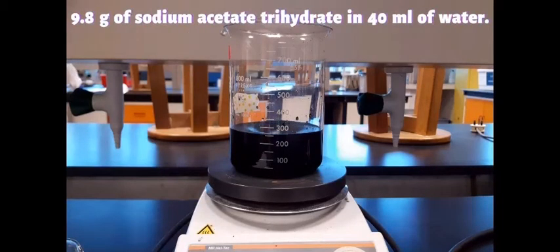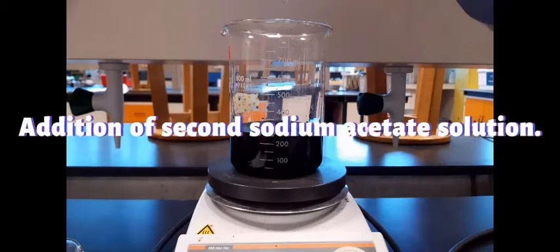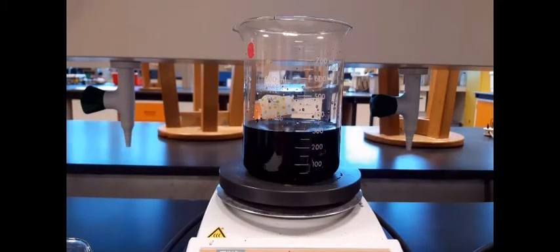Dissolve 9.8 gram of sodium acetate trihydrate in about 40 ml of water. The second sodium acetate trihydrate solution has been completely added.